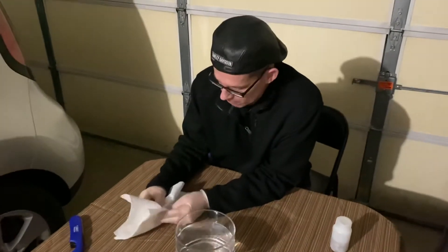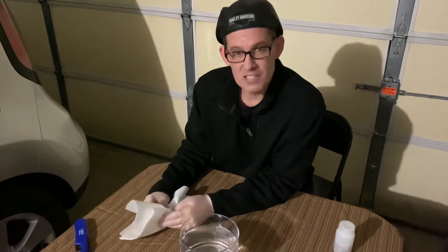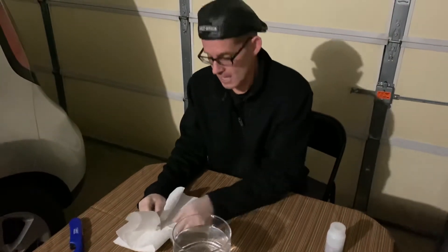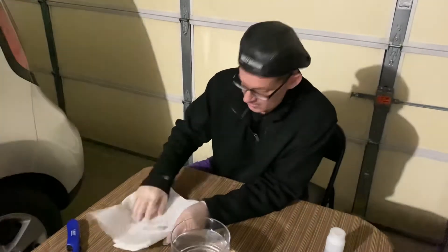Now as I put it in the water, right away there's going to be an exothermic reaction where it starts to release hydrogen gas. This is a single replacement reaction because the water, as it releases its hydrogen, becomes sodium hydroxide and gives off a lot of heat.